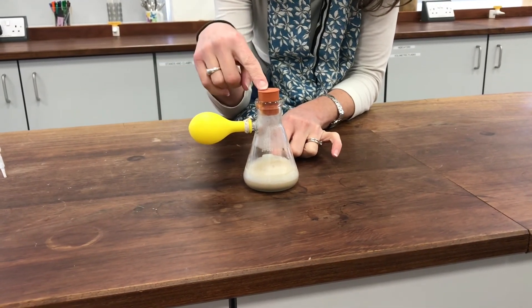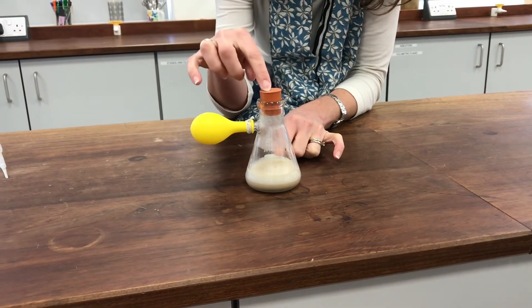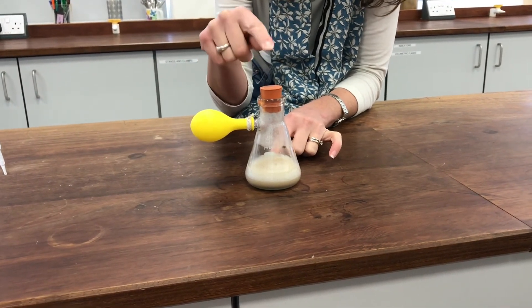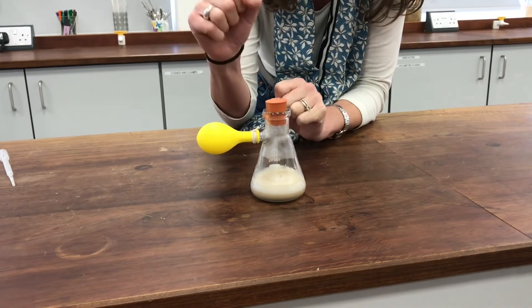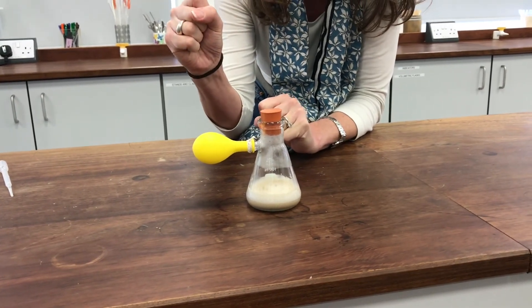But really to test it now, I would need to filter this and try distilling the liquid that I've got at the bottom, and I should find that I've got some ethanol in that.